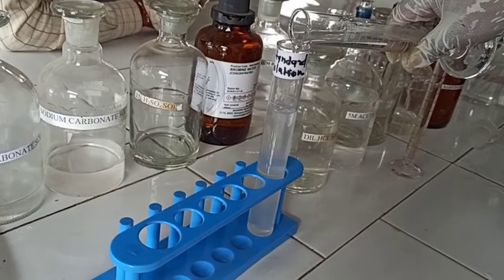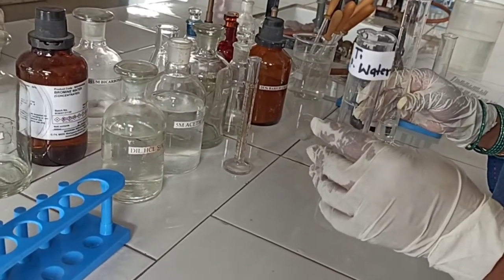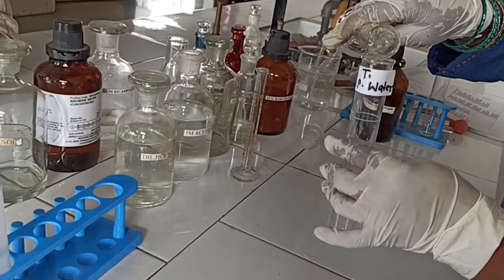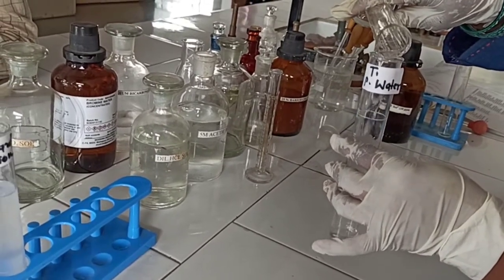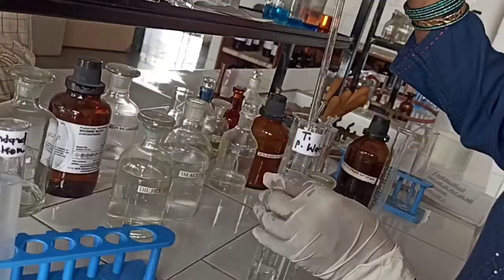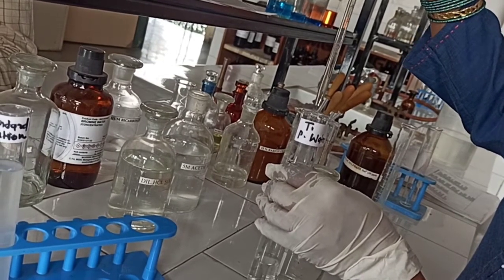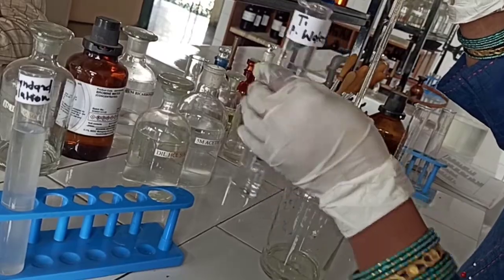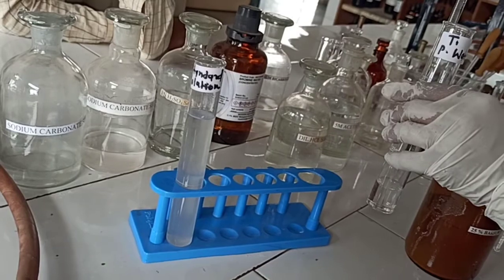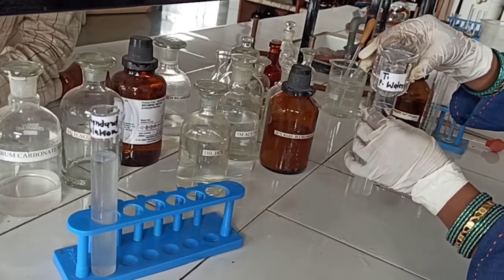To prepare the test solution T1 for purified water, take 10 ml of purified water in a labeled Nessler cylinder, then add 0.1 ml of 2 molar hydrochloric acid. Using a graduated pipette, add 0.1 ml of 25% barium chloride solution, then make up the volume to 50 ml.